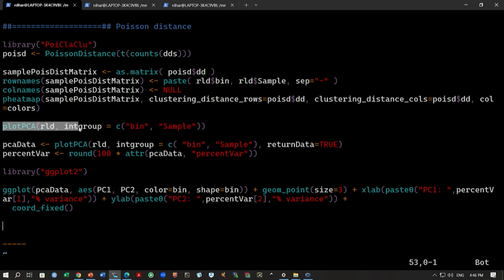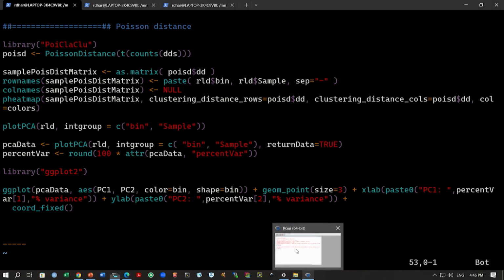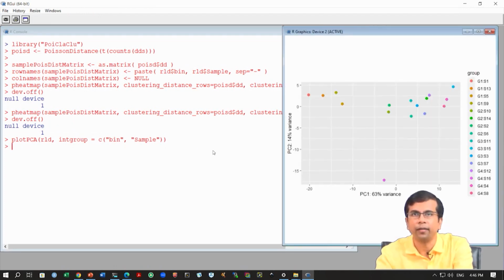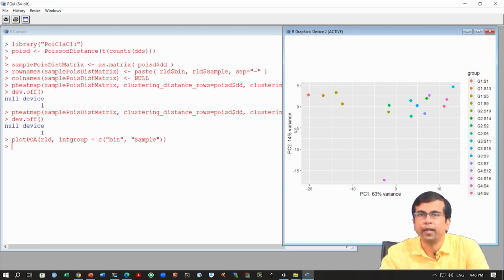So, this is a very easy way to do this, and it will also label based on this bin and the sample. So, let us try this command first, based on this R-log transform data. To see this, we see this PC1 here, and PC1 explains about 63% variance, and then you have PC2 on the y axis, it explains about 14% variance, and you can see these G1 groups are around here, right. So, the samples from G1 group are clustered together in this PC plot, and the other groups are clustered around here. As before, you notice probably G4S16 is somewhere here, right.